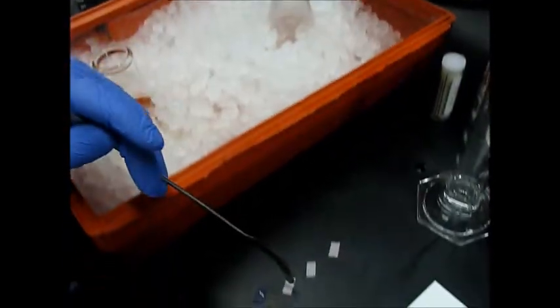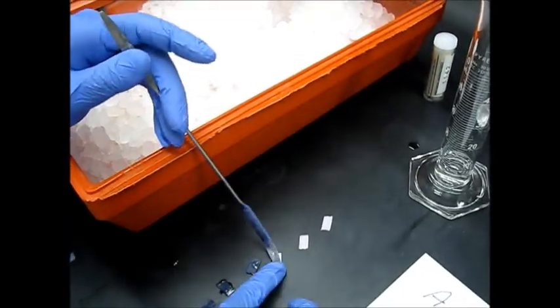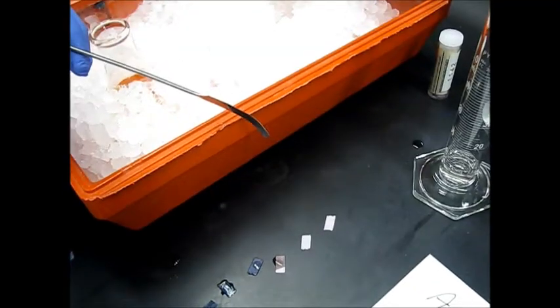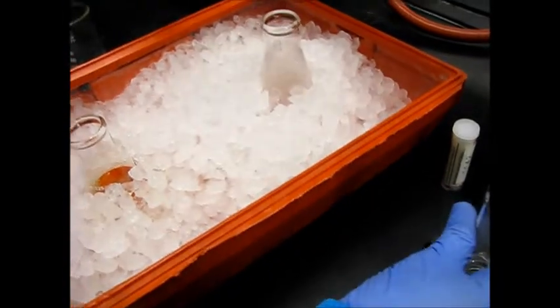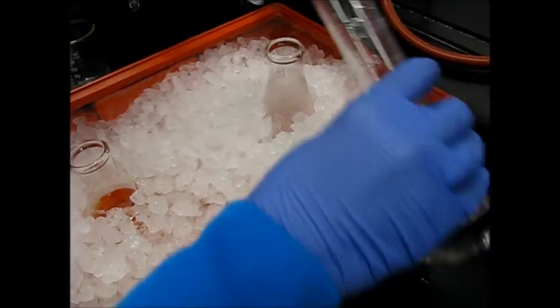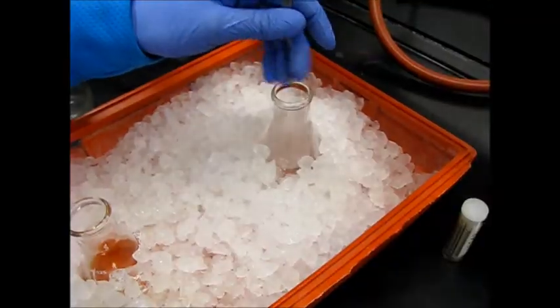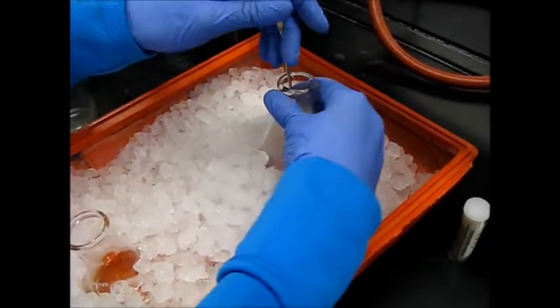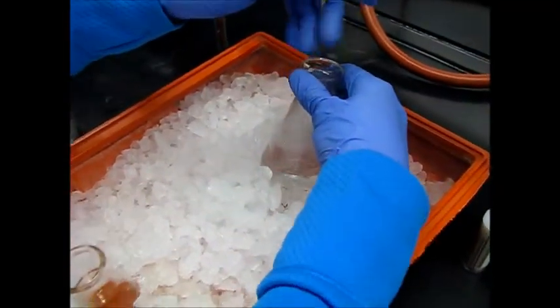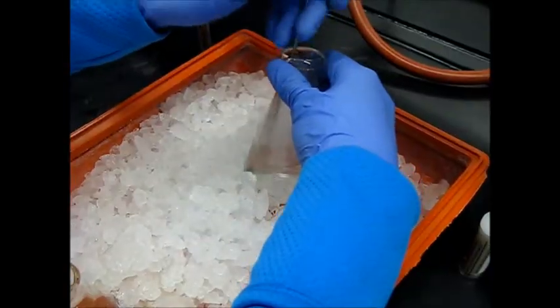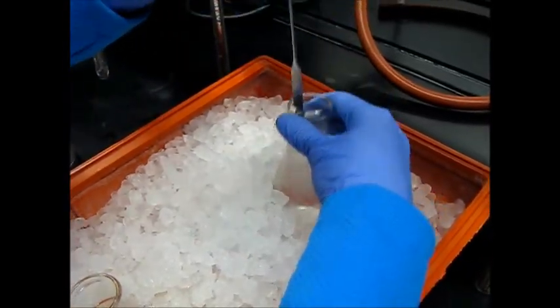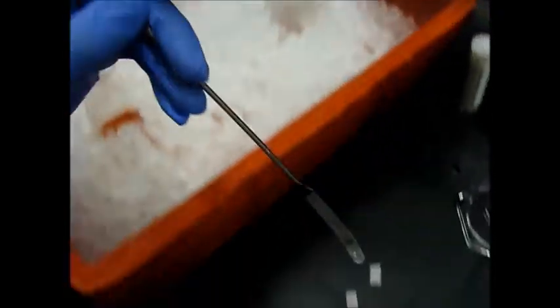Test it again. It's pretty neutral, turning pink. And a little bit more, a little bit more just to ensure that it's acidic. Stir. You can see that it's clear. And now we will wait for some time to start to see the precipitate.